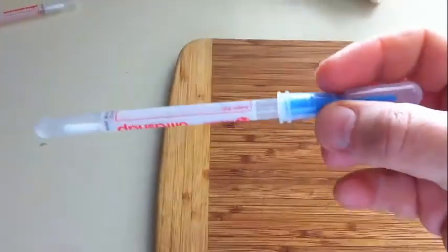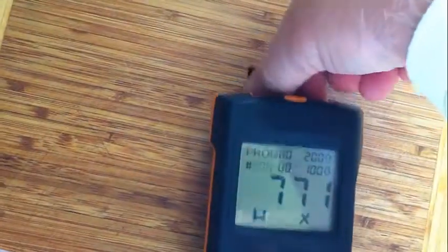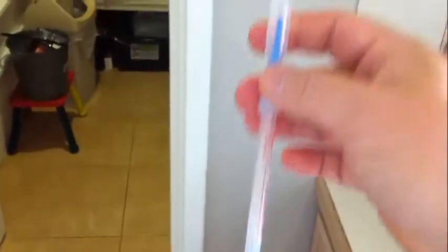Probably should have let that dry a little bit more — it's only been drying for about 3 or 4 minutes. But we'll give it a go and see how it goes, so I'm just going to do the same here. Just give it a good coverage. It should really be left until it's properly dried, but hopefully this will give a decent result. That's now back in its little thing. Pop that out and grab the previous one.